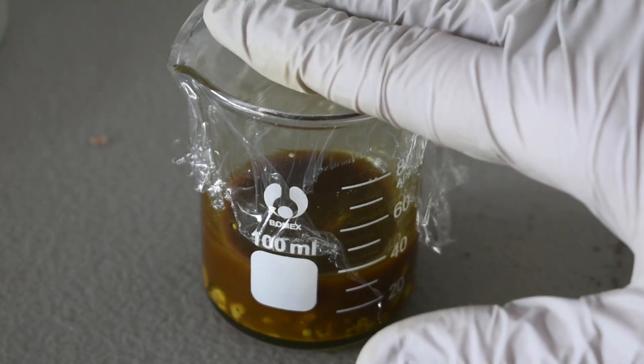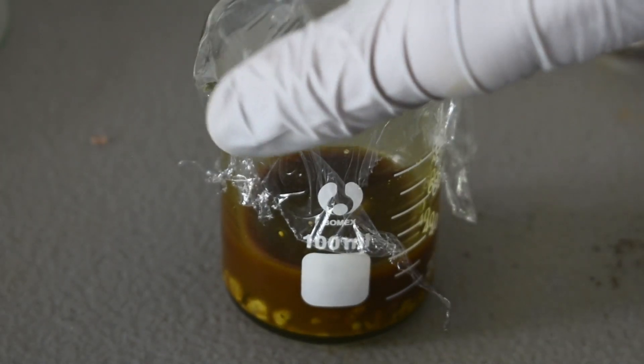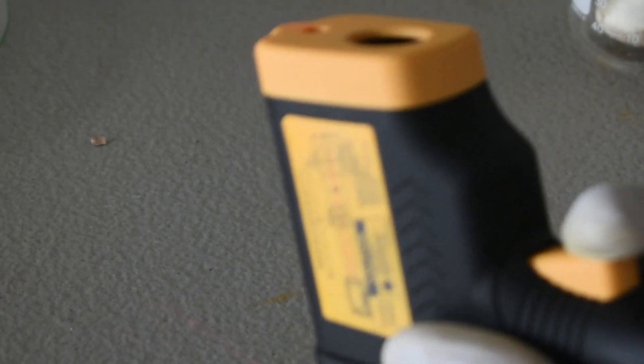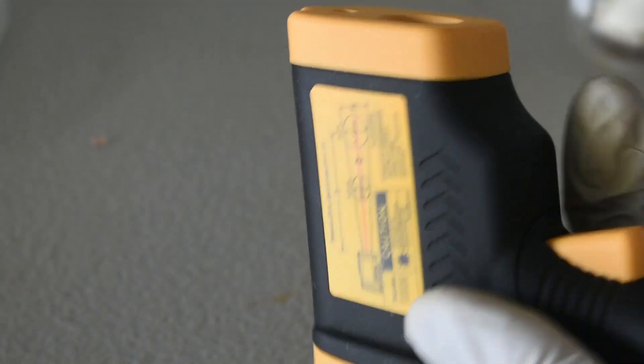I've got some plastic wrap over the top of the beaker. And it's actually gotten quite hot. The temperature of the beaker is already up to 61 degrees.